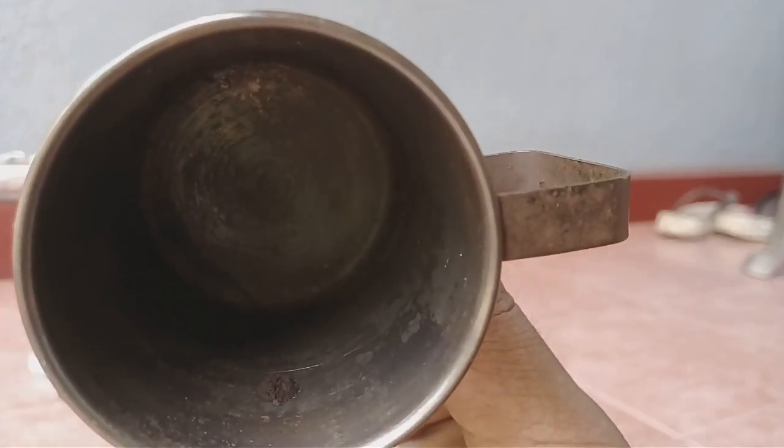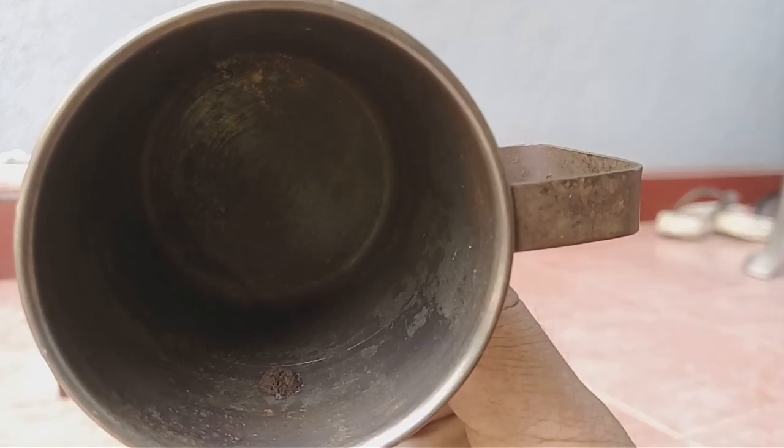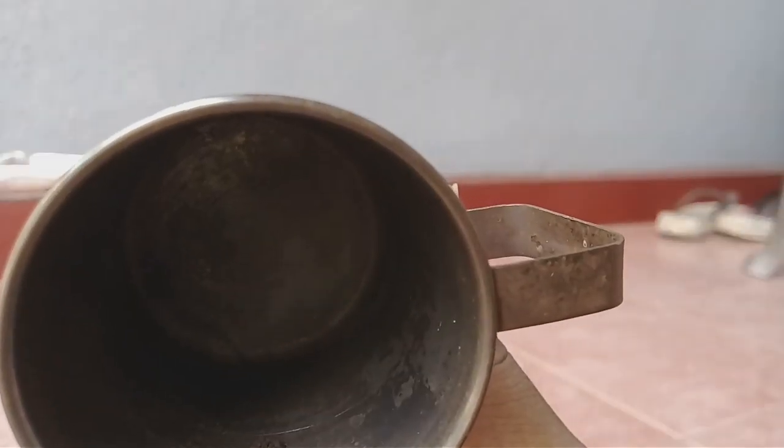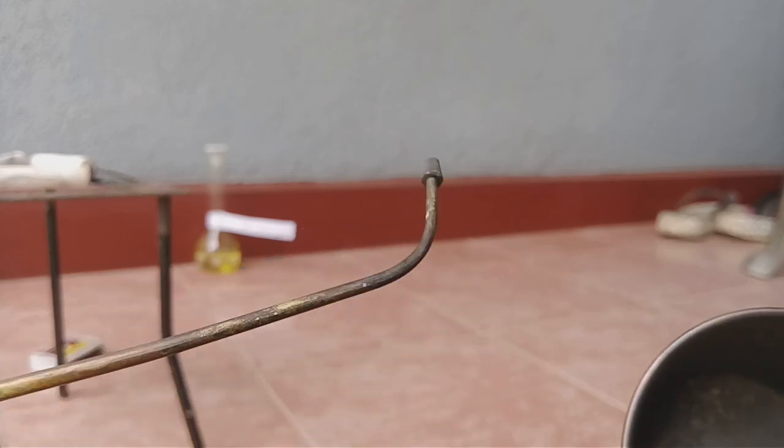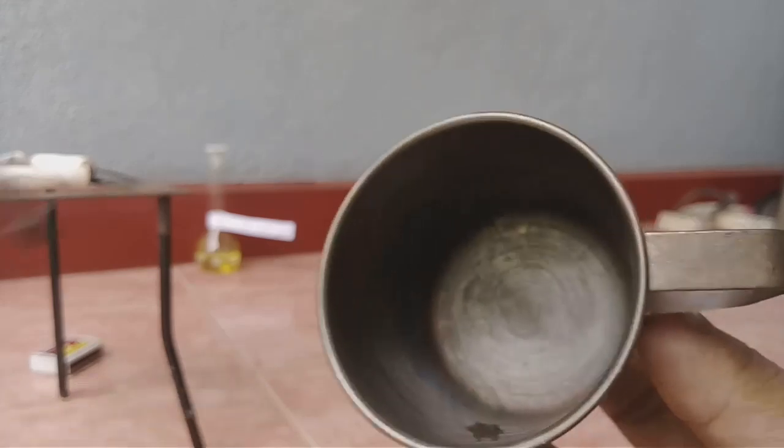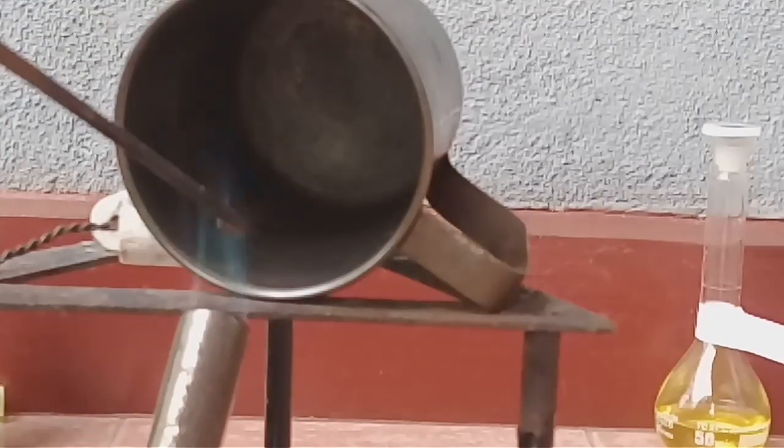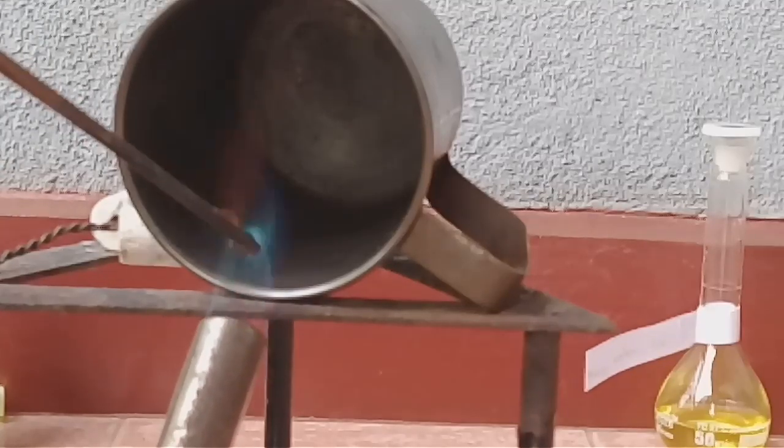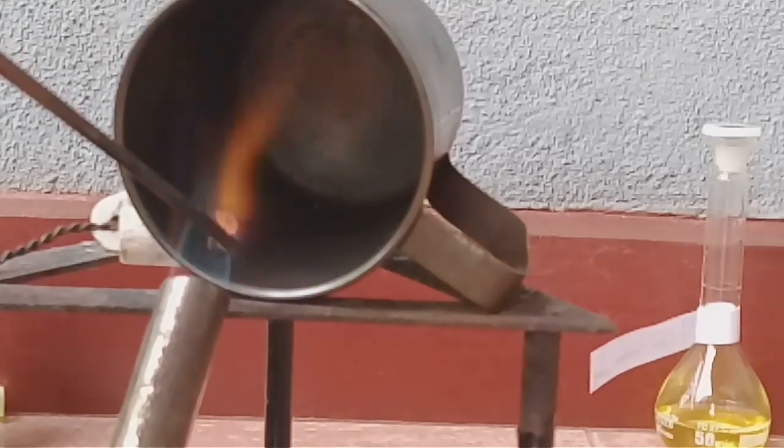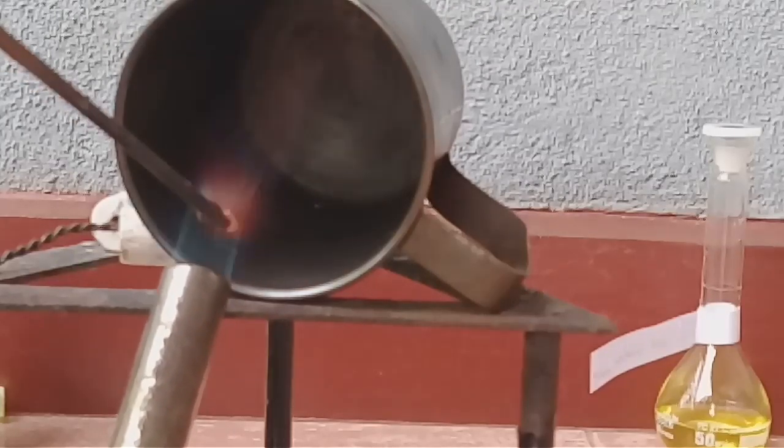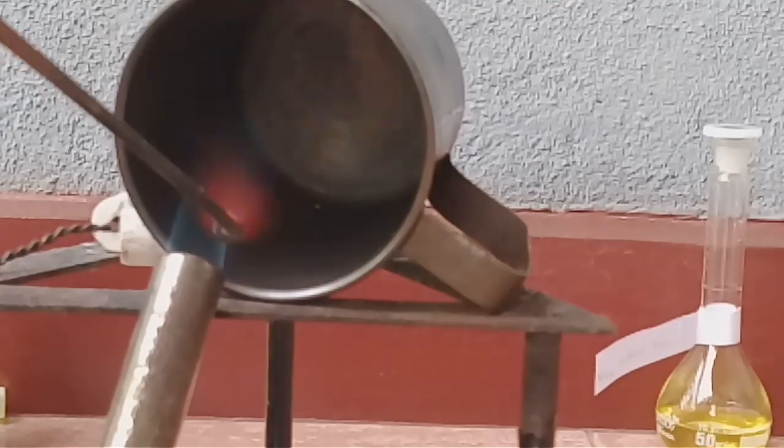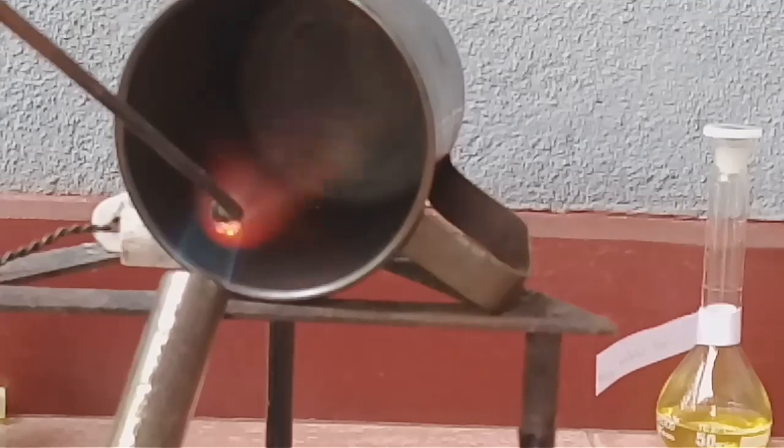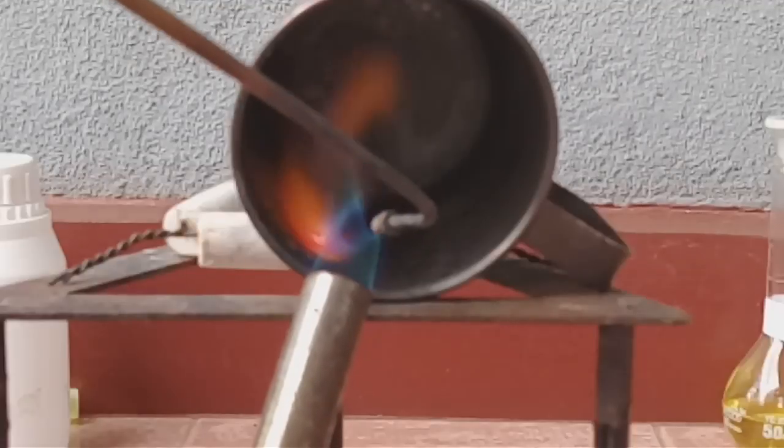Now I am going to heat this gold precipitate by this blow pipe.